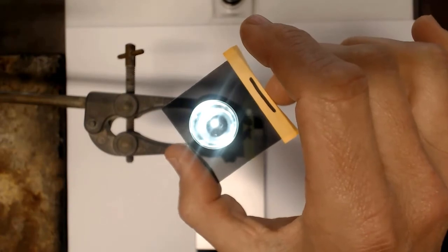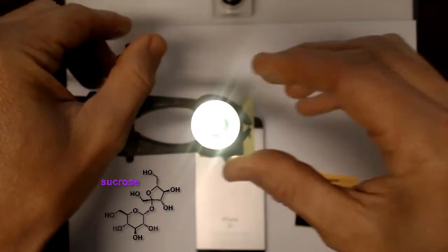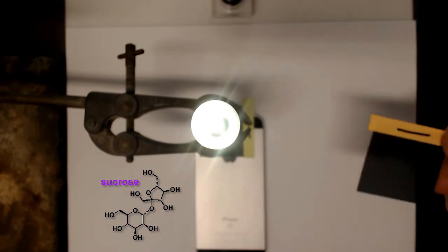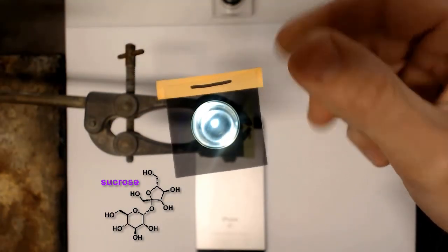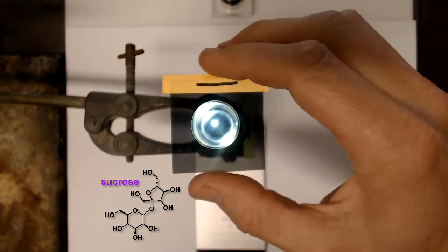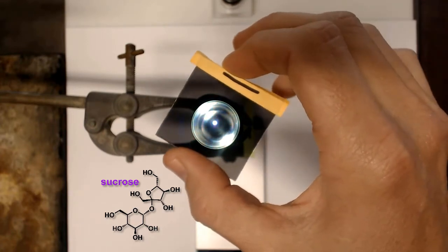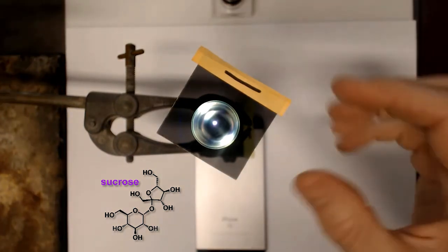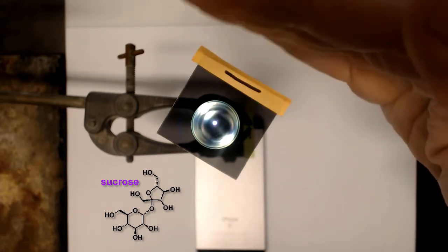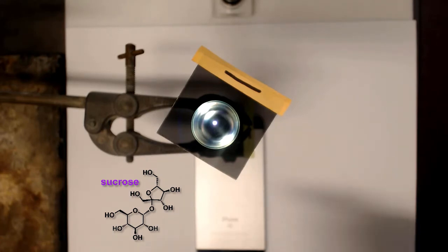If we now switch out this water and use sucrose — a solution of table sugar — this is a naturally occurring molecule which we know has nine chiral centers in it. It is optically active. So I put my filter on at 90 degrees. If it were water it would have extinguished things, but it doesn't — we actually see light coming through. If we start rotating slightly to the left, the light gets a little brighter, but if we rotate to the right it eventually extinguishes. Sugar rotates light to the right, and this is a fascinating property of chiral molecules: the ability to rotate plane polarized light in one of two directions, to the right or to the left.